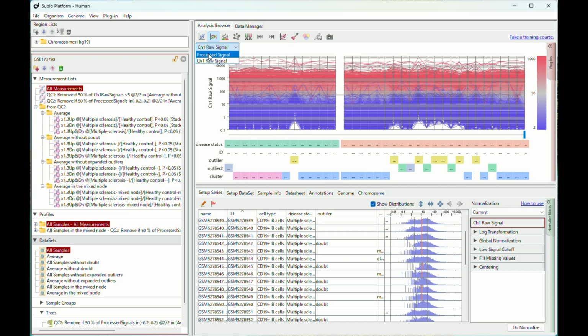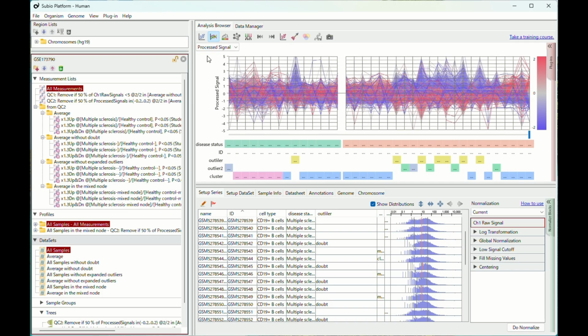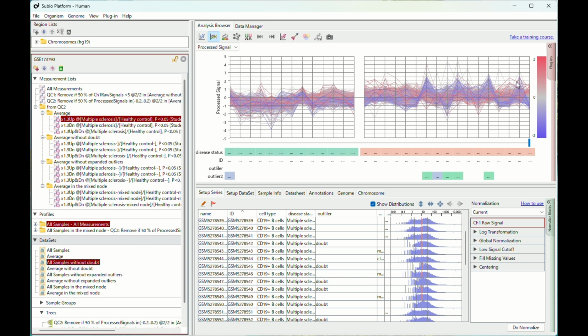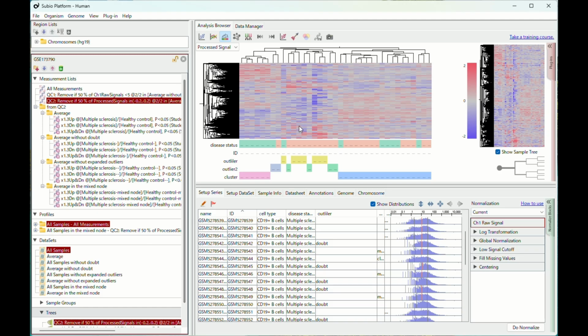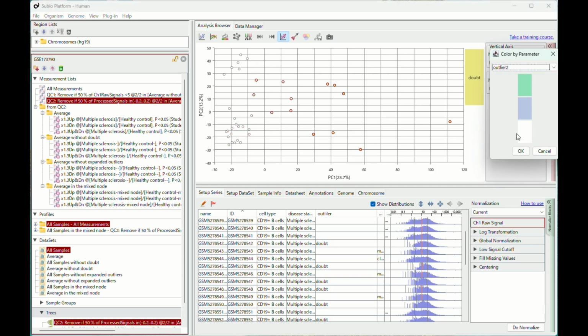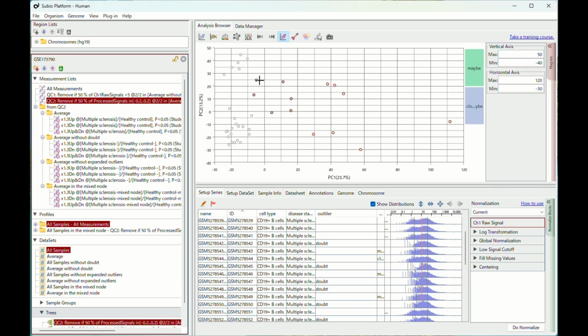The thoughtlessly identified upregulated genes are, ironically, at least in part likely the result of normalization. Even if you remove the doubt samples, there are still samples under the effect. These samples are under the same tree node as the doubt samples. These boundary samples are close to others, but still share the expression profile with the doubt samples. So remove them.